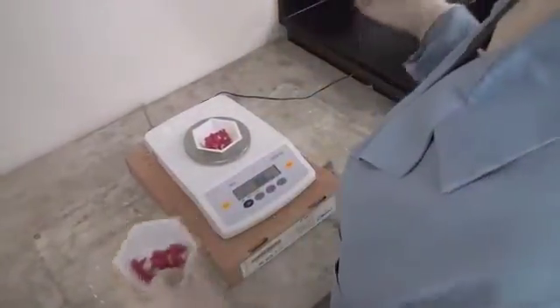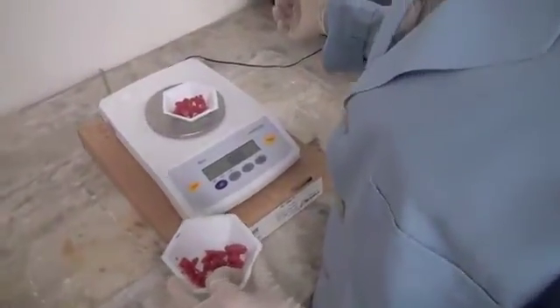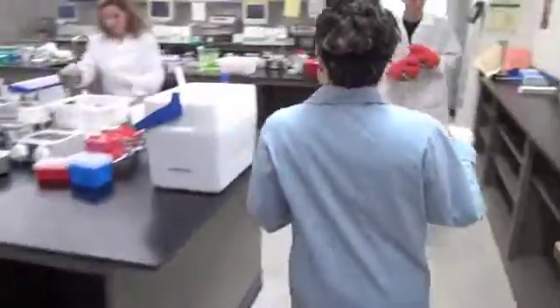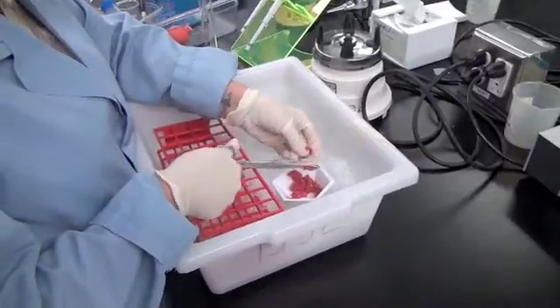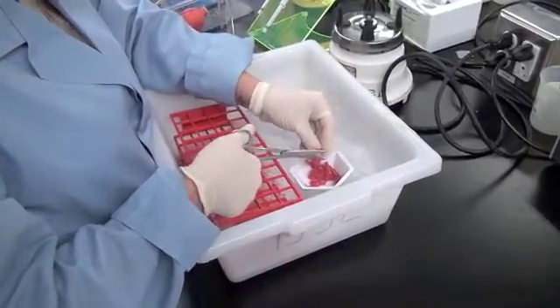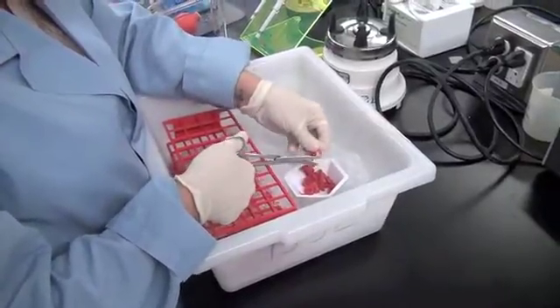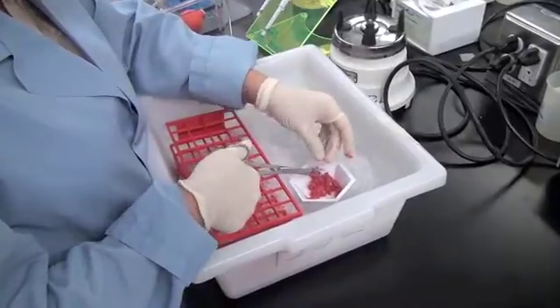Dr. Beckman? Yes? Is it necessary to weigh out exactly 8 grams? No, Miss Entropy. She should weigh out around 8 grams plus or minus 0.1 grams, as that should not affect the efficacy of the later purification steps. Now Biochemist Dicer is cutting up her weighed muscle sample into smaller pieces, so the blending step will be more effective in lysing the cells. And she's doing this over ice. Oh, I see where Biochemist Dicer gets her name.